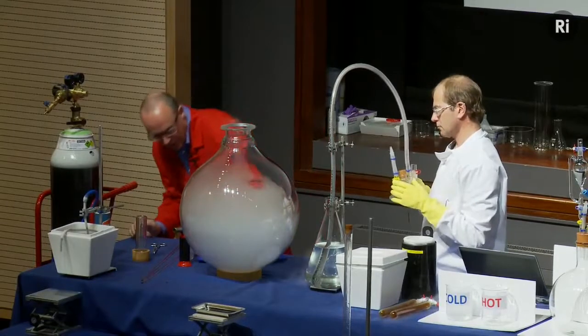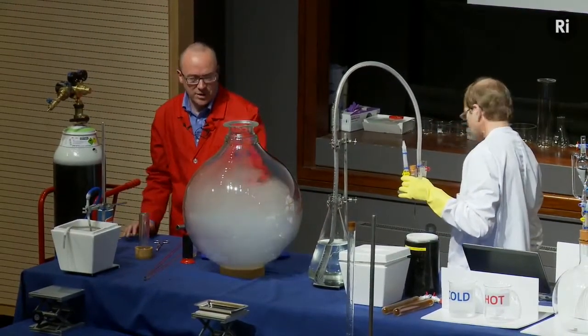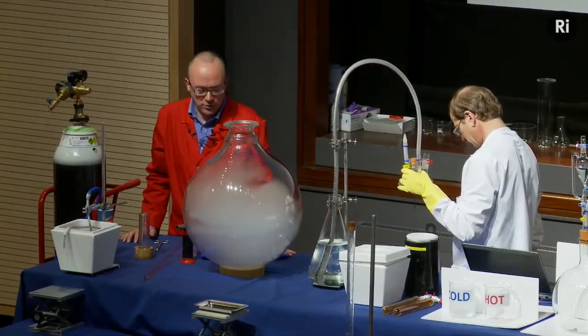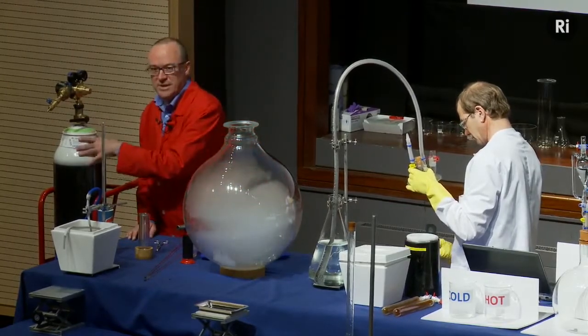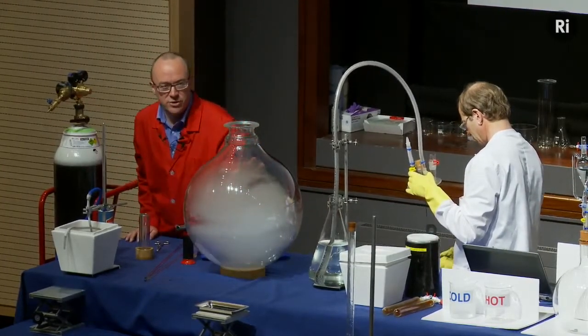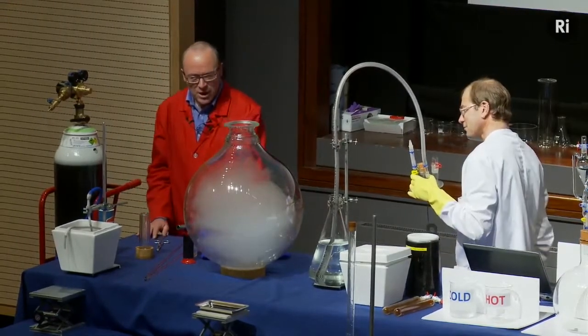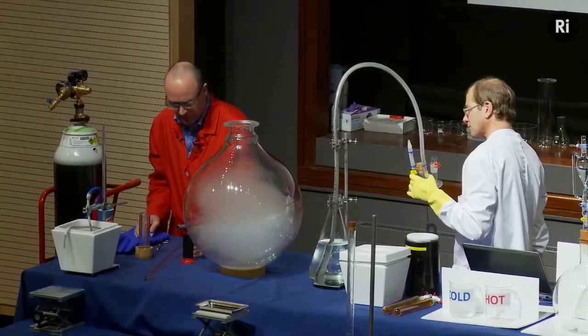Okay, you can see a little bit of liquid oxygen there, that lovely blue colour sloshing around in the bottom of this flask. So that's gradually evaporating, and that's filling the flask with pure oxygen. Of course, we could have just taken a hose from this cylinder into the flask and filled it with oxygen that way, but I think this was more fun. Okay, while that last little bit is evaporating, the next thing we're going to do is to get some phosphorus.